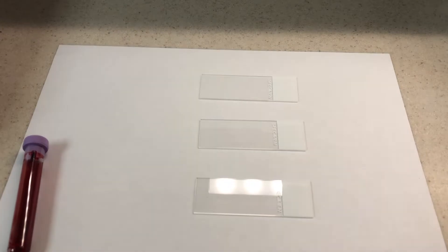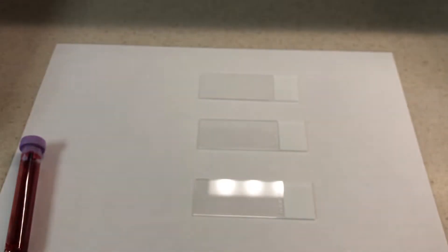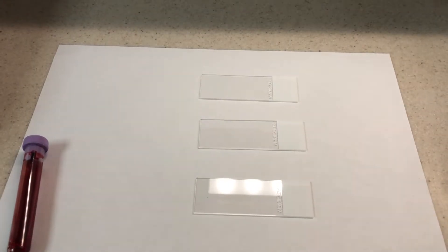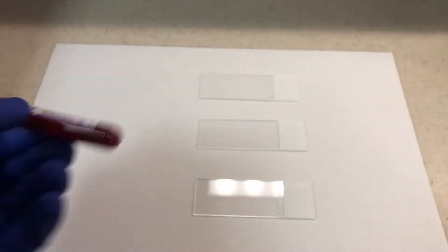There's either using capillary tubes, little blood dispensers, or the tried-and-true wooden applicator sticks which serve a dual purpose.